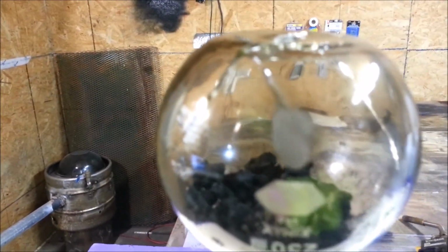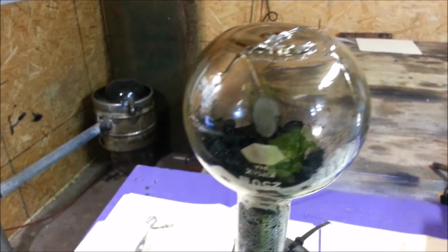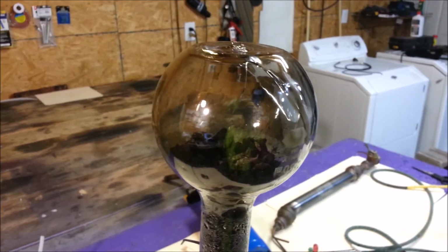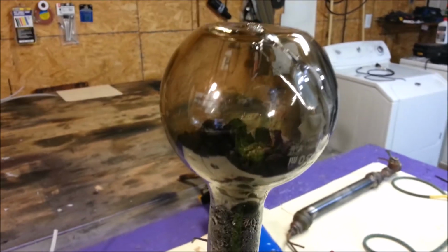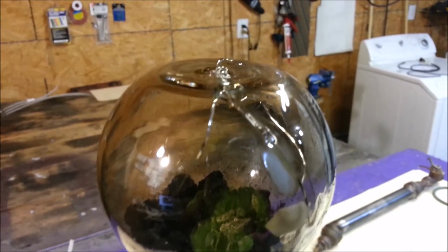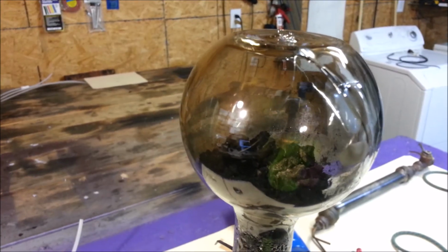This experiment is done. I'm going to have to try it a different way. But it did prove that it doesn't work. Definitely something going on. You would think if anything, the size of the flame would just decrease if it was a pressure issue. So strange. Maybe something is getting in the flame that's of such high contamination value that it extinguishes it. I don't know.